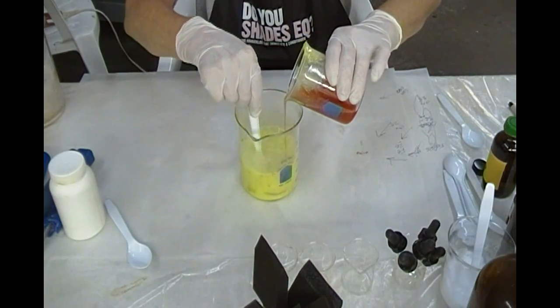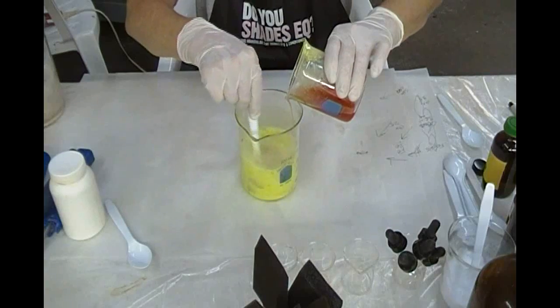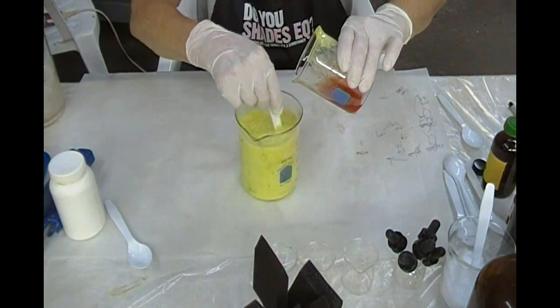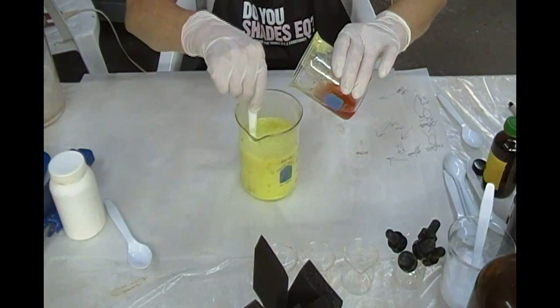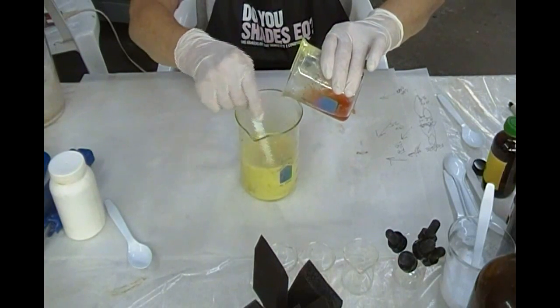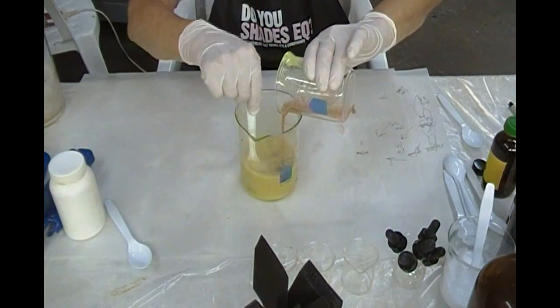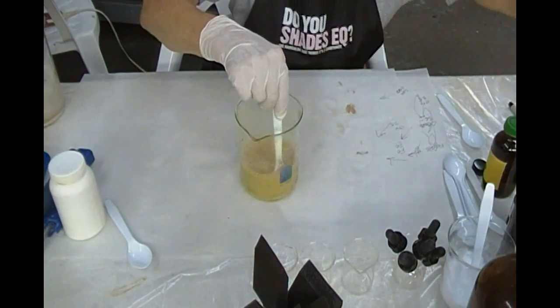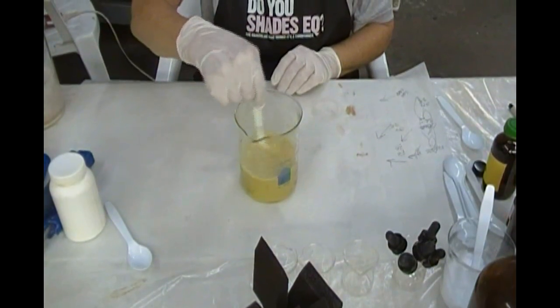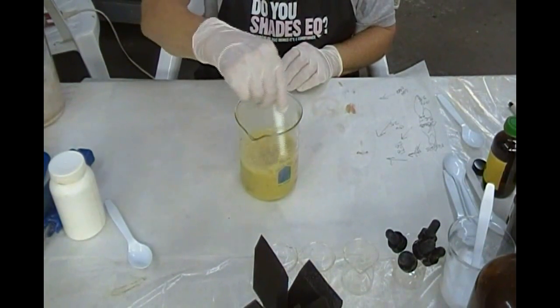Careful, Maddie. The oxalic acid is poisonous, but what do we mean by poisonous? That's sort of a catch-all term for 'it ain't good.' Toxicologists say the dose makes the poison. If you have a good diet, you're probably eating a good amount of oxalic acid in your weekly diet. It is what makes green leafy vegetables have that bitter taste. It has been calculated that twenty pounds of spinach is enough to kill a normal-sized human being — and imagine trying to eat twenty pounds of spinach.